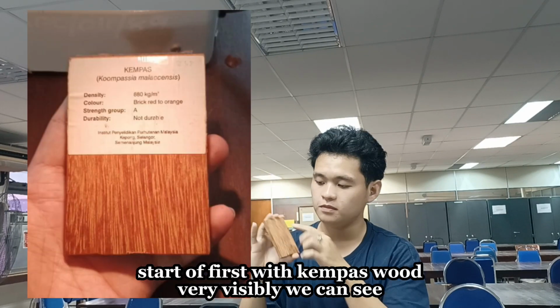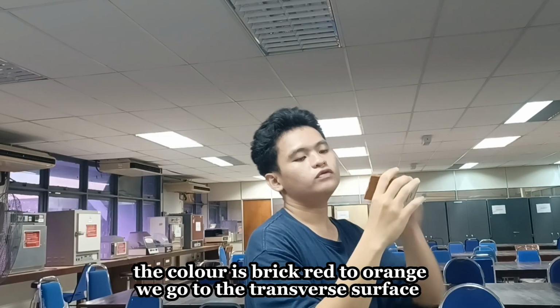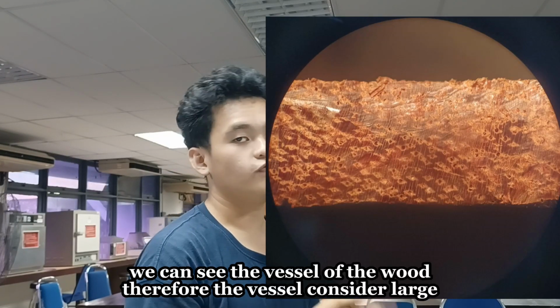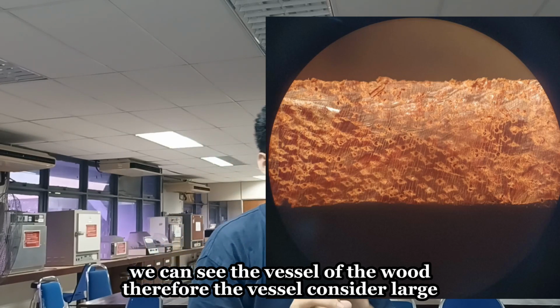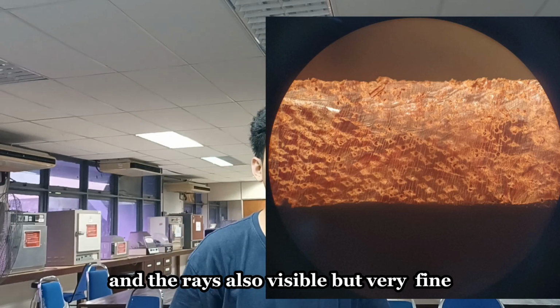Start off first with kempas wood. Very visibly, we can see the color is brick red to orange. When we go to the transverse surface, we can see the vessels of this wood. Therefore, the vessel is considered large. And the rays are also visible but very fine.